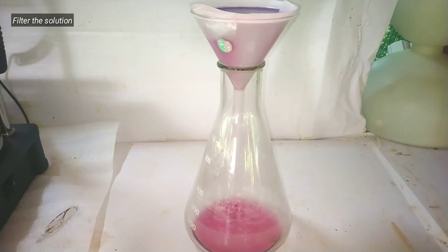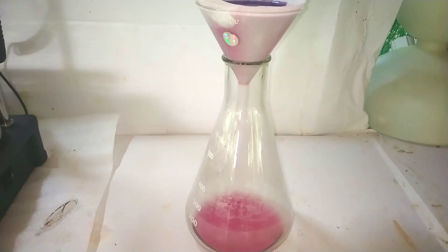Since the particles are very fine, it would be easier to do a vacuum filtration if you have that setup.